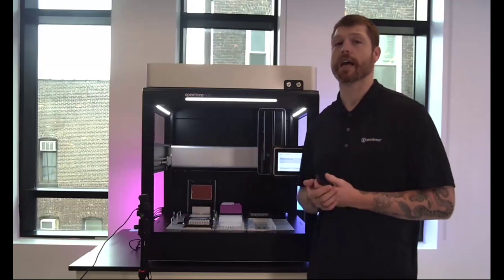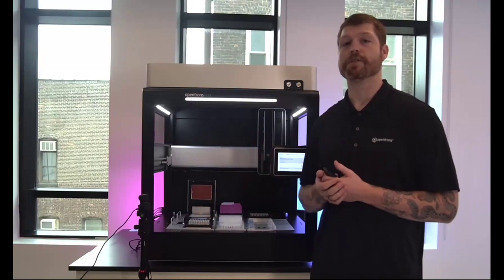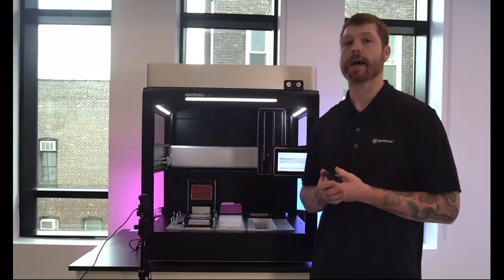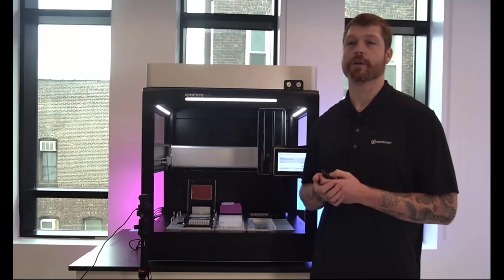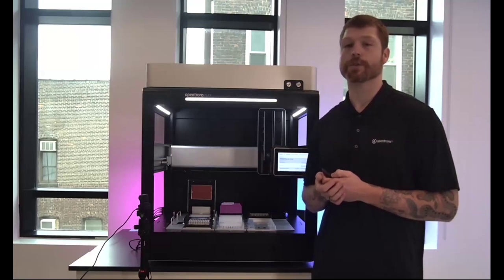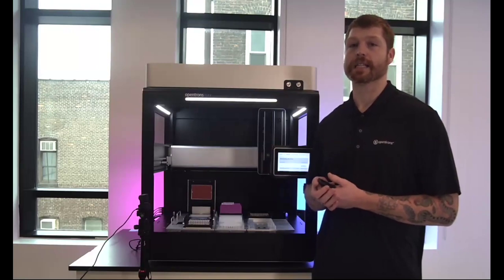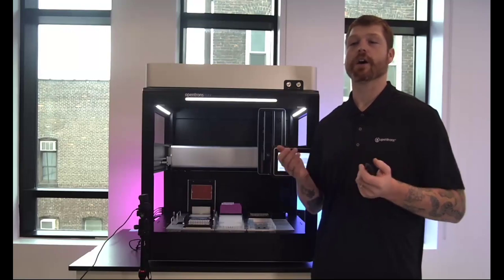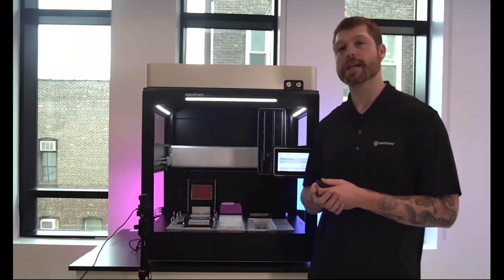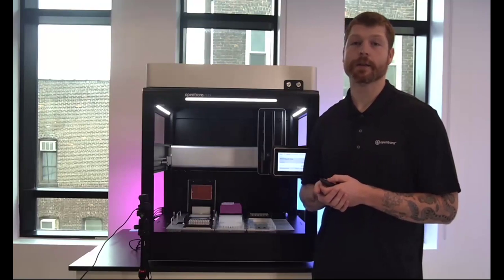This is really great for lab spaces where you just need to do a quick stamping action. You don't want to have to get out a pipette and do this yourself. Obviously, the same benefits of automation hold true here. It's a lot more reproducible of a way to ensure that pipetting is being done the same between yourself and all of the other members of your lab space. And really just a great utility of the Flex instrument.